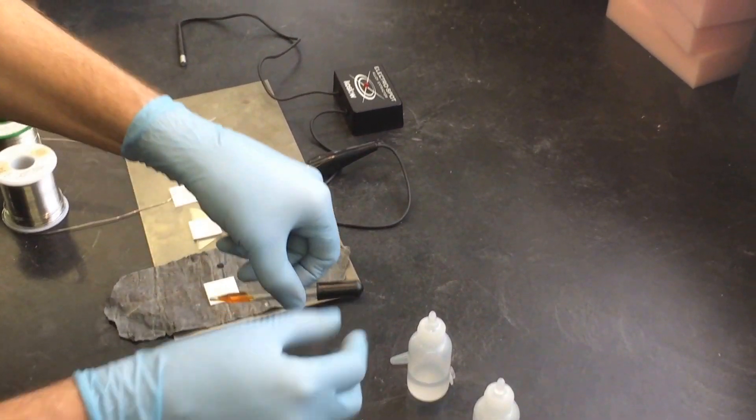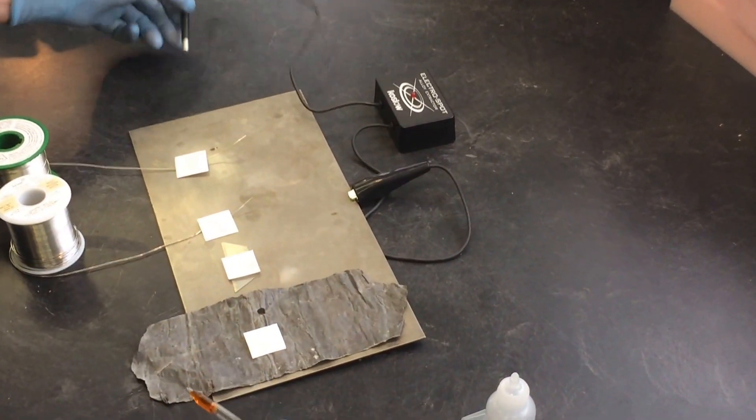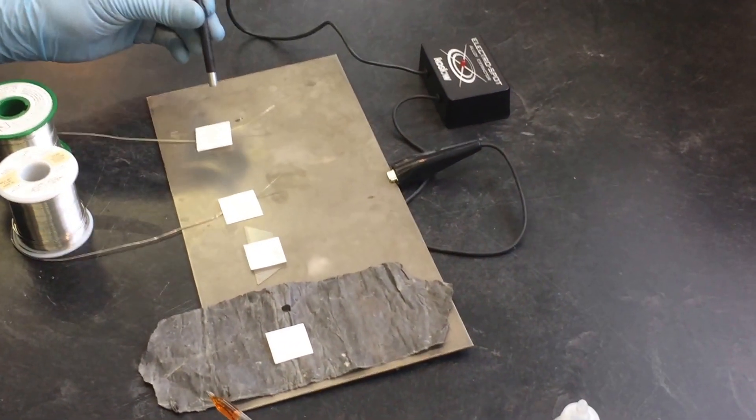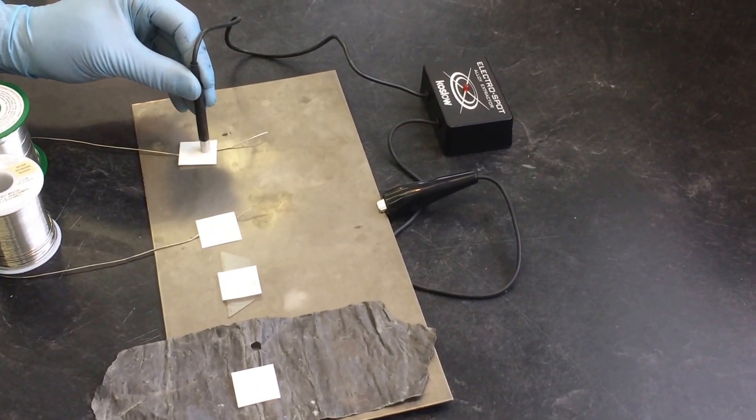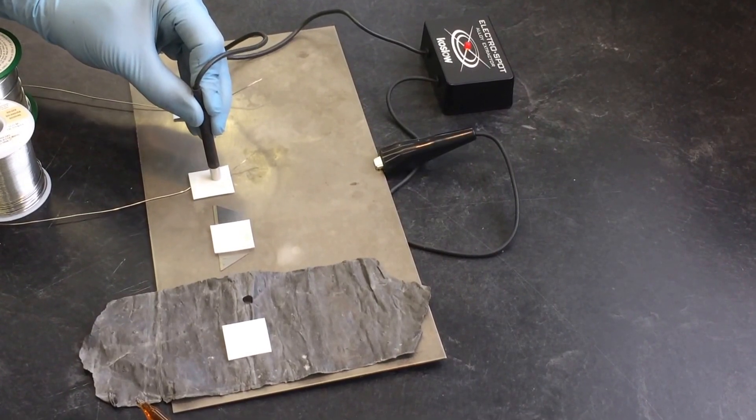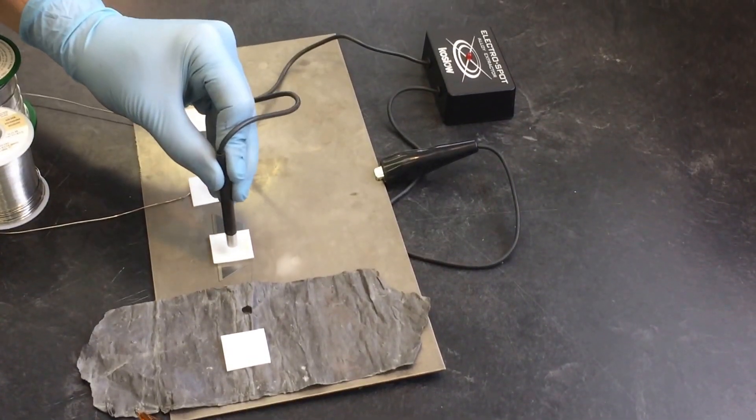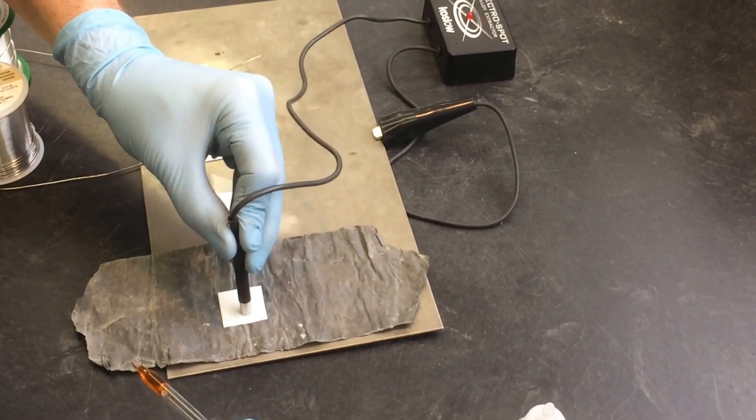Pick up a small amount with your medicine dropper like I did. And let's apply. First I do the electro spot process. So, it only needs about one second of this process. One, one, one, and one.